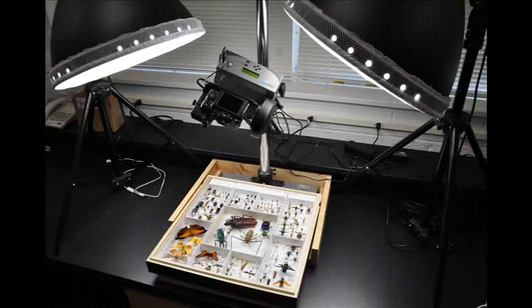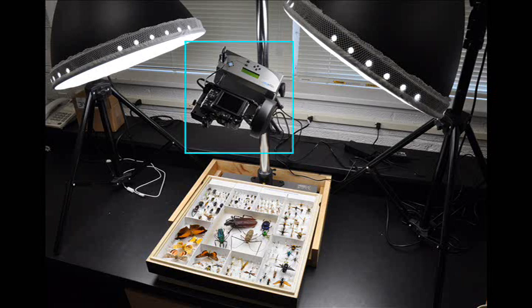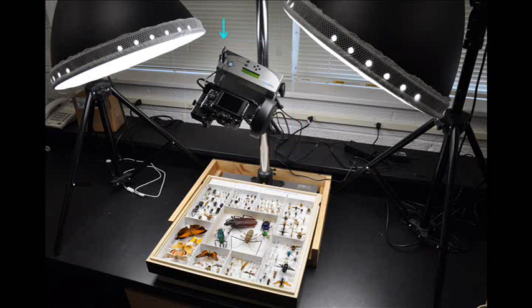To achieve the results presented here, we first need to assemble the right equipment. We employ a GigaPan EPIC 100 series silver model robot, paired with a Canon PowerShot G11 camera. We used an AC adapter with the robot and the camera for continuous power, which is advisable if undertaking a large scale project without having to replace batteries often.